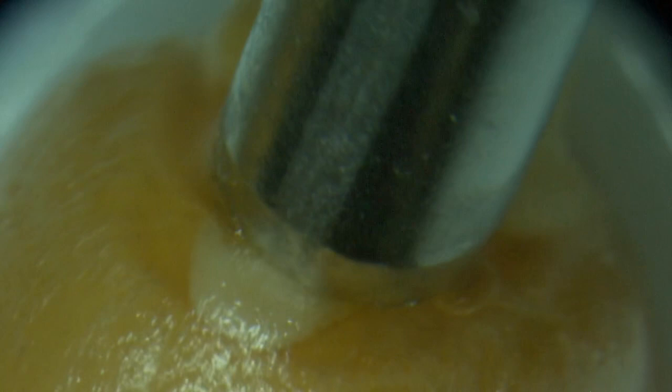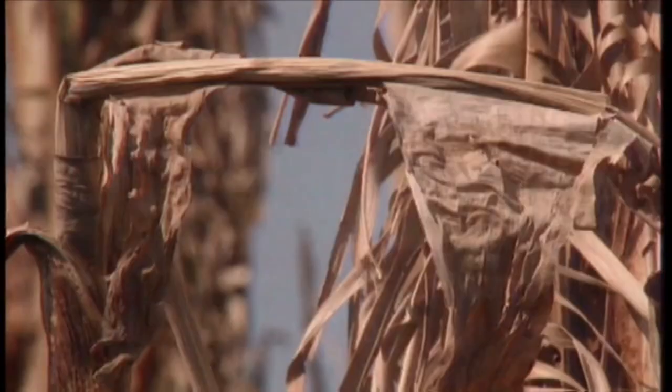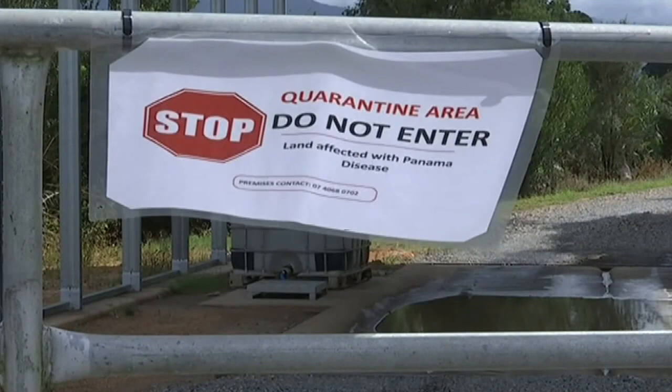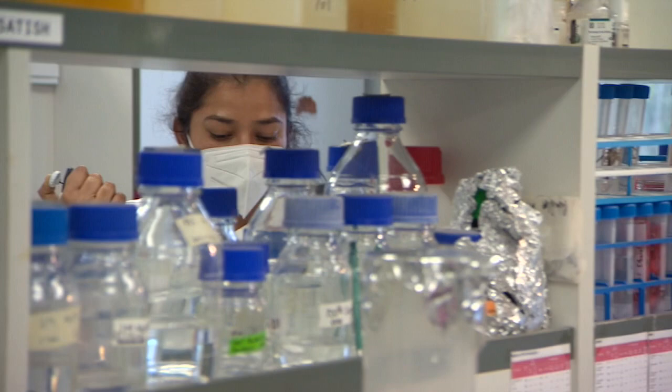Here's a demo with the embryo of a wheat seed. Called grafting, they piggyback the shoot of the plant they want to protect to the root of a plant that can resist the disease. The reason we think it's significant is because there's a possibility it can be applied to important crops that everyone is familiar with, such as banana — and at the moment there's a disease that infects banana's roots, and if we could graft disease-resistant roots onto banana, that would be a potential solution for that problem.